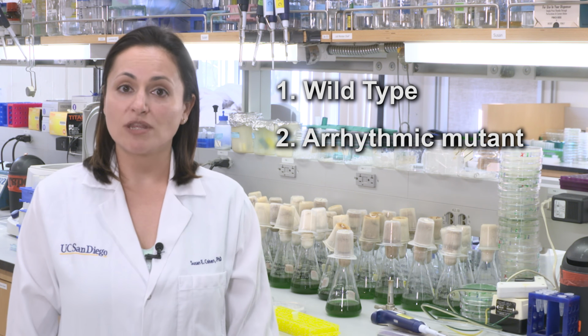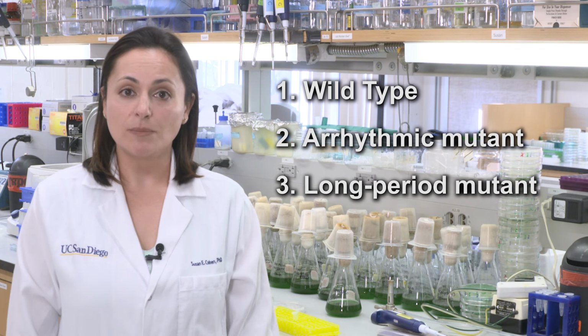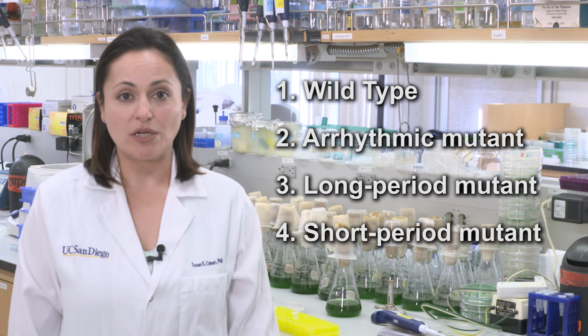Today, I will show you 4 different samples. First, an unaltered or wild-type sample with its clock genes intact. Second, an arrhythmic mutant. Third, a long-period mutant. And fourth, a short-period mutant.